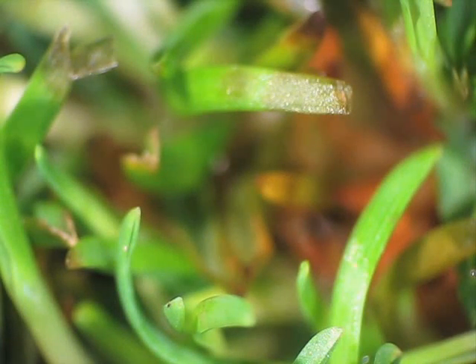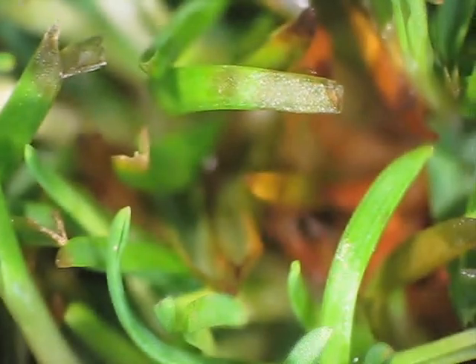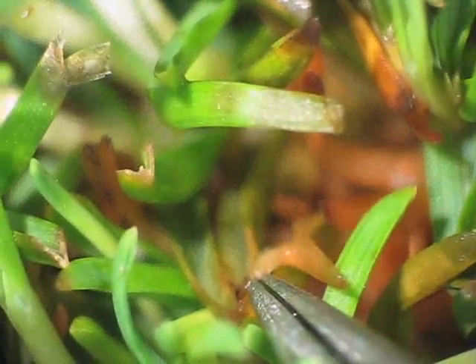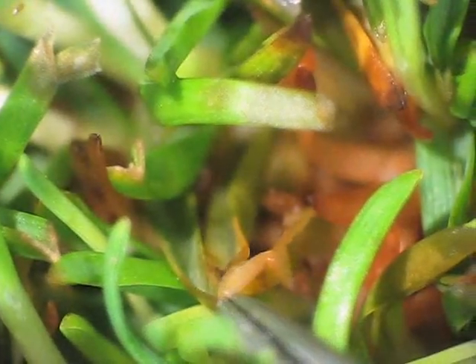Then put that piece of tissue on a microscope slide, and always take another sample — the other half of that leaf. Reach back down and grab it to rip it off, and put that also on the slide.